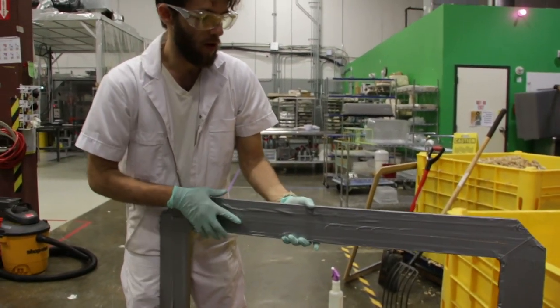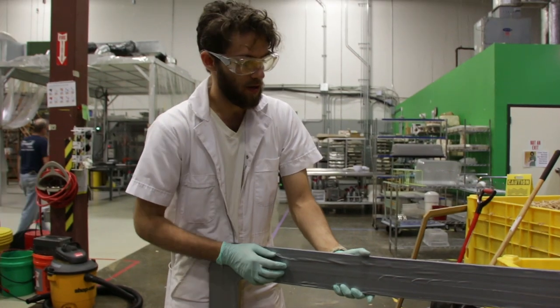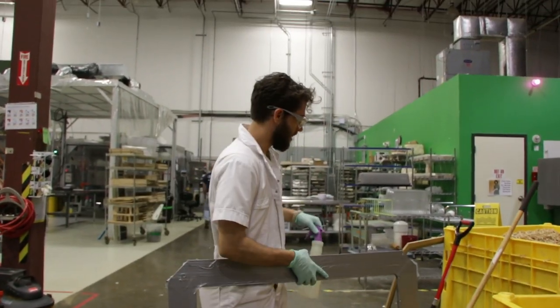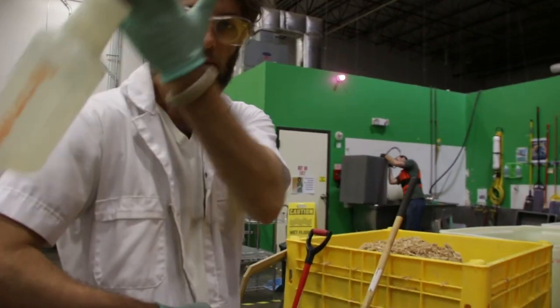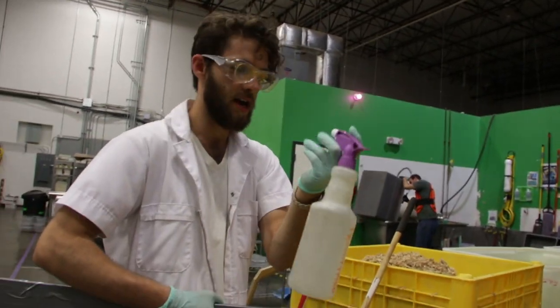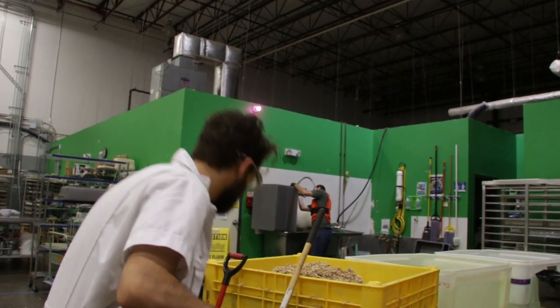You can see that one side is uncovered and the other has duct tape on it. We do that so that this porous wood material won't allow mycelium to grow into it. We're going to sterilize it now with some isopropyl alcohol, wearing the proper personal protection — gloves and glasses.